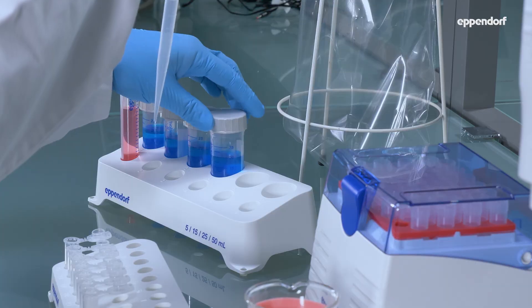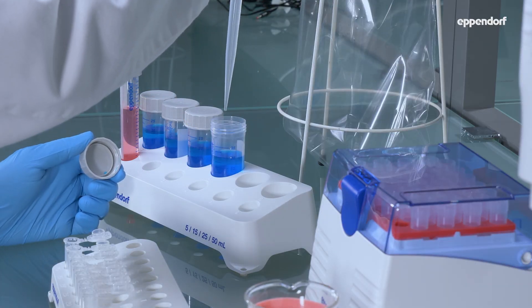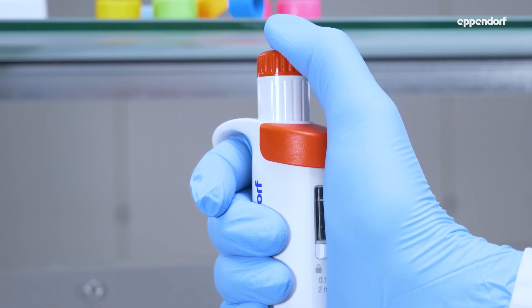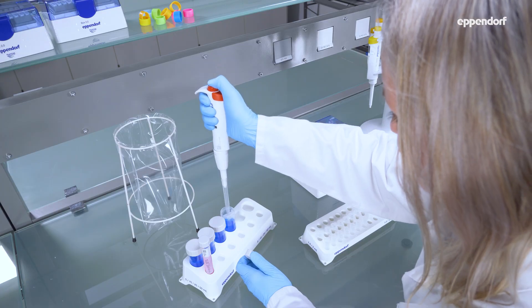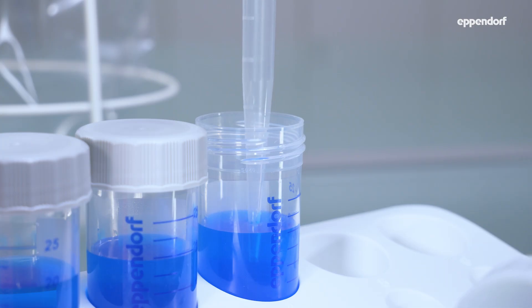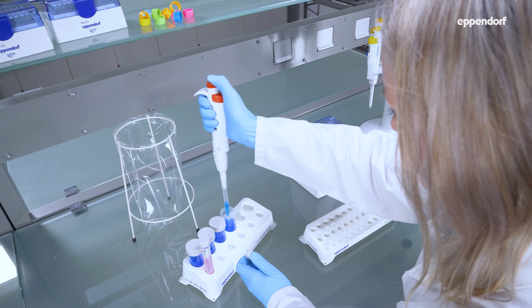Forward pipetting is the standard technique used for most samples. Push the control button down to the first stop, hold the pipette vertically, and immerse the tip slightly into the liquid. Release the control button slowly.